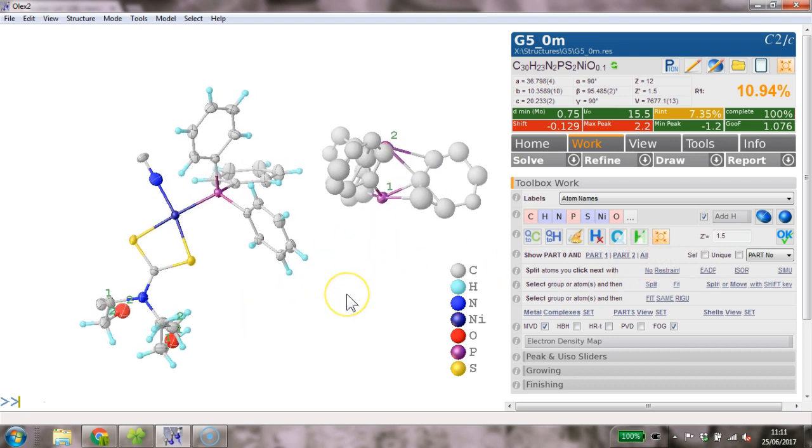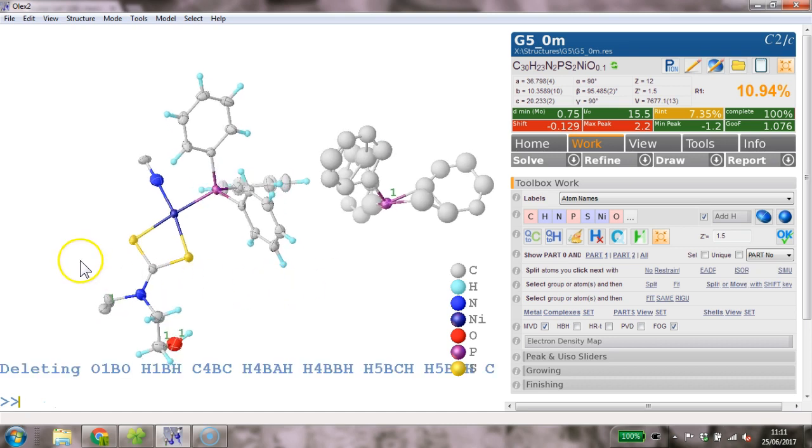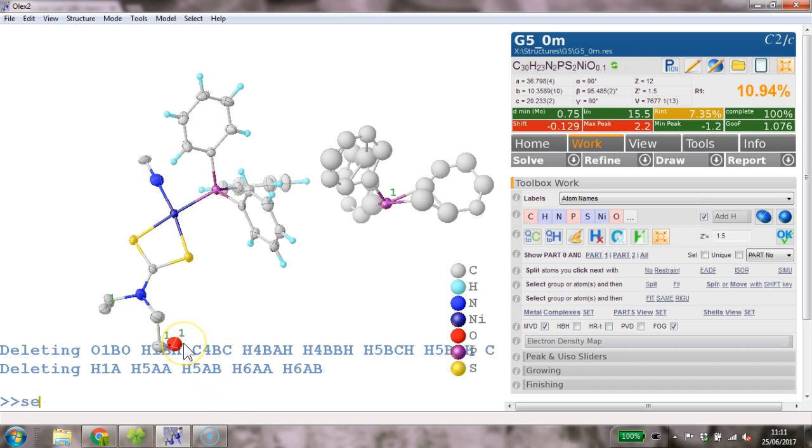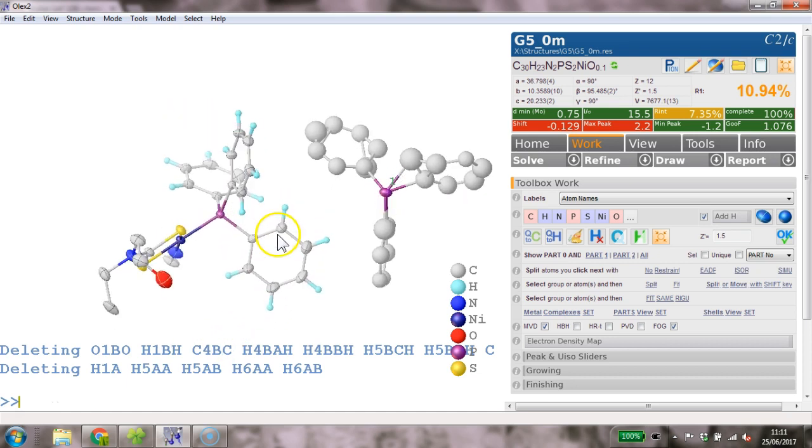So what I will suggest is we select part 2 and delete everything in part 2. And then down here, we also delete the hydrogens, kill $H, and I would go sel back. So this is the previous selection. Oh, that hasn't worked because the hydrogens have been deleted. There we go. Select those ones and say part 0 and set the occupancy to 1. So we don't model any disorder down here at the moment at all.